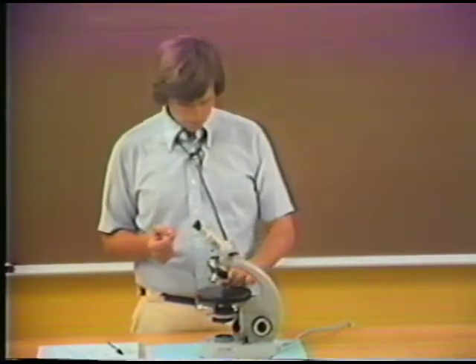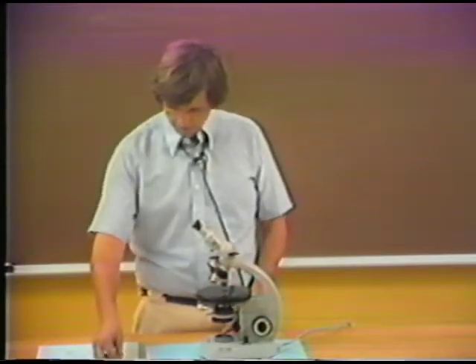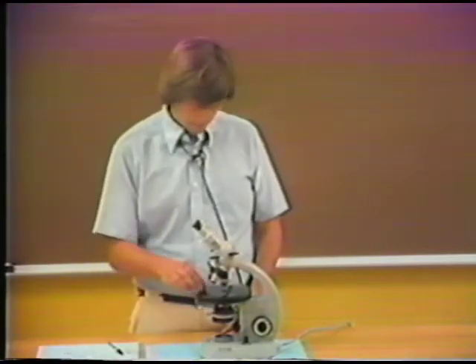Now, another way in which the symmetry of the mineral is expressed is by cleavage. And I want to show you another anisotropic mineral. This is a thin section of a pyroxenite, and we're looking at the pyroxenite now in plane polarized light. And the pyroxenite, of course, contains large amounts of pyroxene.